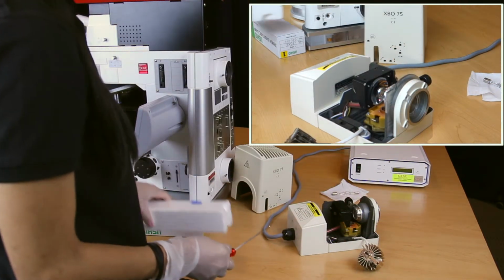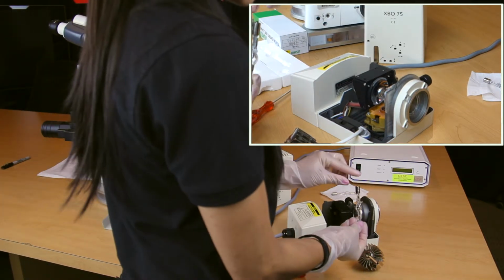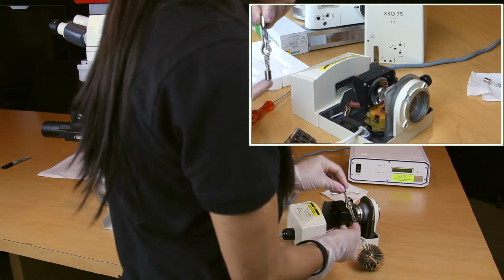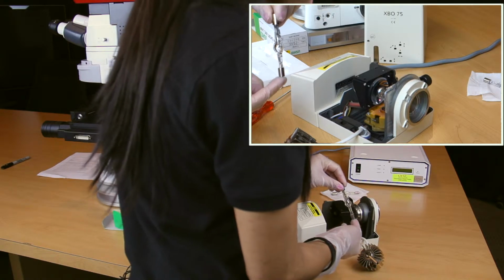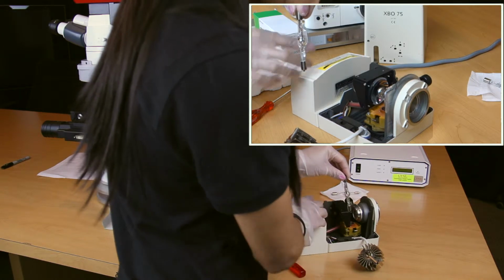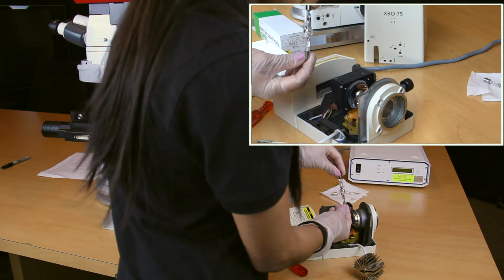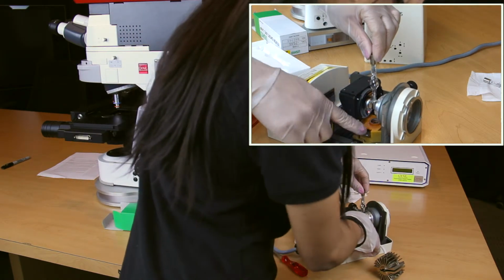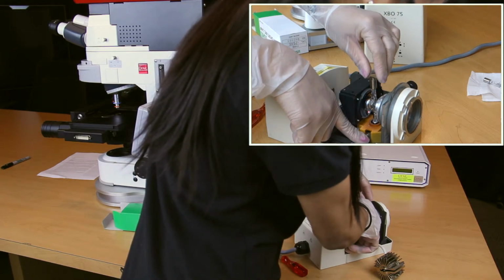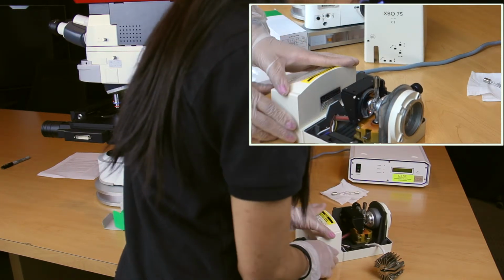Then you'll get your replacement bulb. And as you notice, there are two different sizes. You have the larger size and then a smaller size from the top and the bottom. Always make sure that you insert the Xenon bulb on the smaller side into the lamp socket itself. And you'll also notice that there is a small bump here on the side. You always want to make sure that the bump is perpendicular to the light output. So once you insert, push down the silver lever, insert perpendicular to the light output, and go ahead and let go of the lever itself.